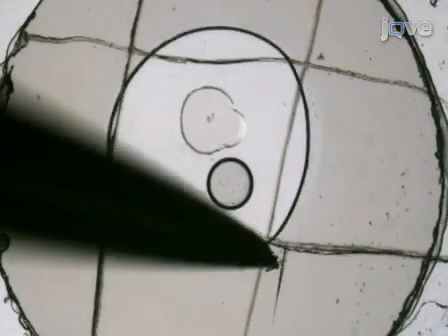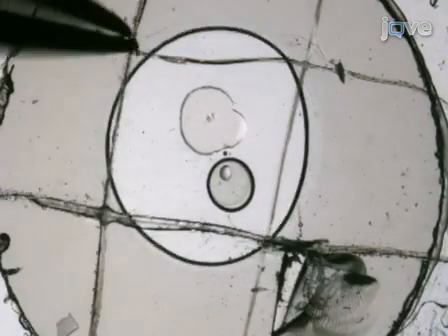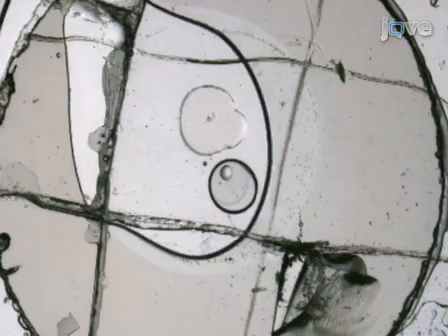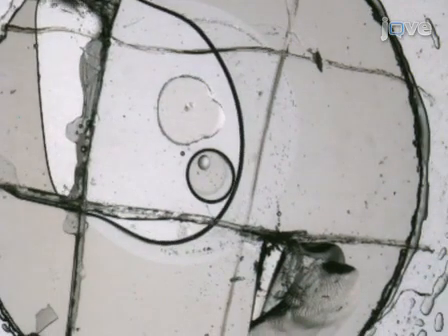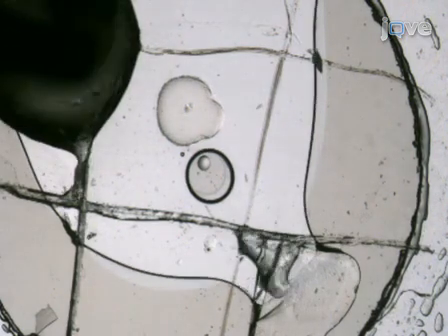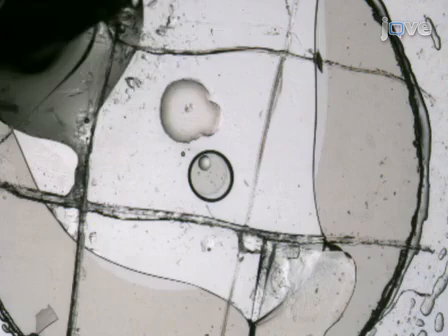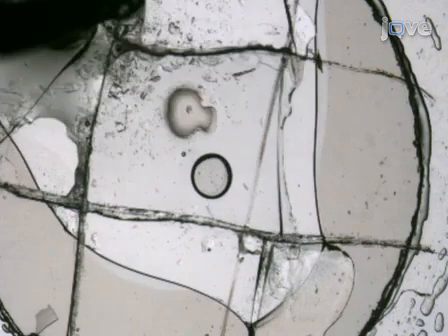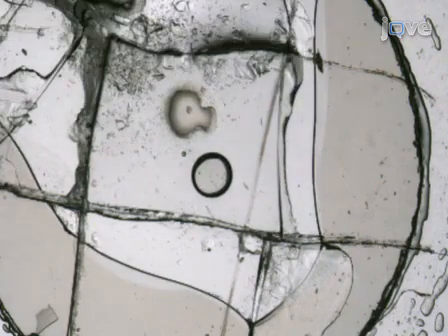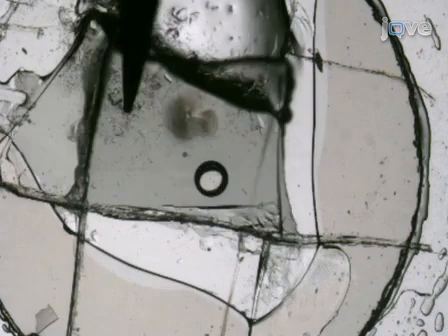Press around the scored perimeter with strong, sharp point tweezers to propagate the scratches through the thickness of the cover slip glass. Punch 2 small holes at opposite corners of the scored square. Inject a few microliters of precipitant solution through one of the holes to reduce dehydration during the subsequent steps. Using an angled sharp needle probe, break up the glass along 1 or 2 sides to free the cutout square. Carefully lift up the glass square, watching for the cubic phase bolus.